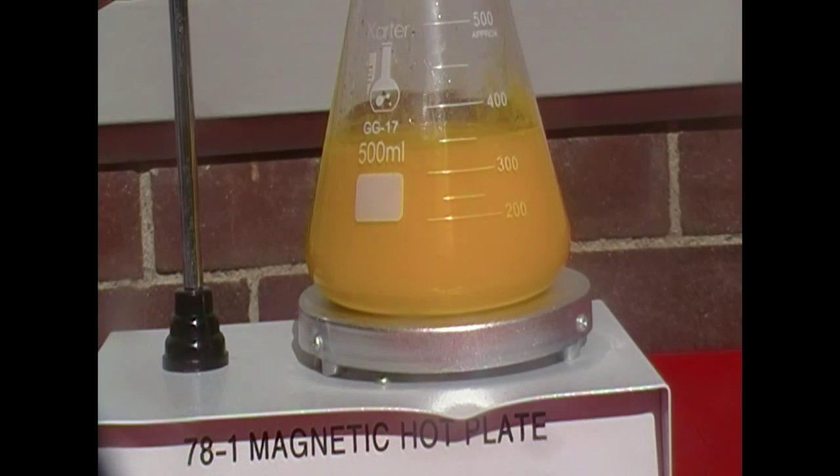Now when you heat up a precipitate, it dissolves into the solution. With this situation, if you let the solution cool after heating, it will form beautiful gold crystals of lead 2 iodide. Since I added too much, again, it takes a bit longer than expected.